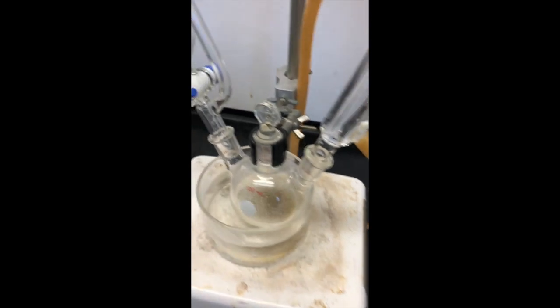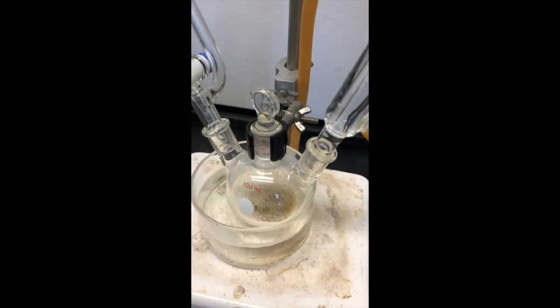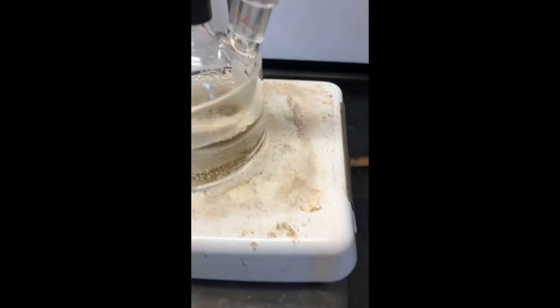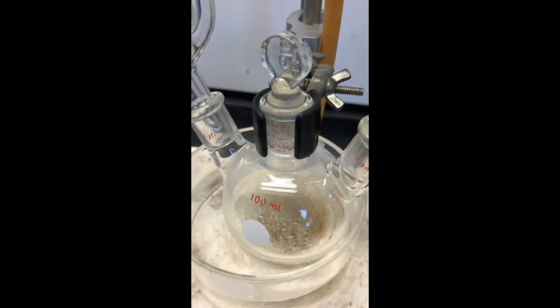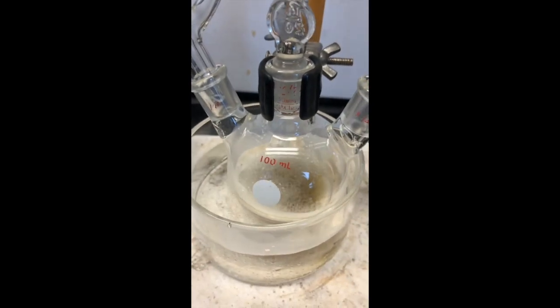We're in the middle of our 20 minute boiling or reflux period here, and you can see the mixture is starting to turn darker. We've had to add more hot water so that the ether will stay boiling.